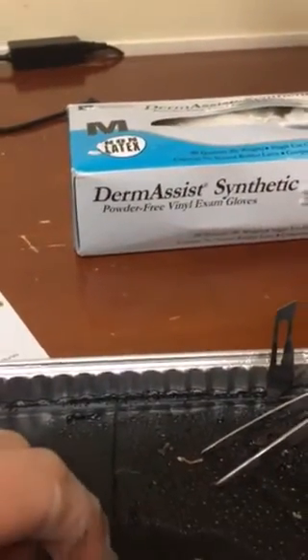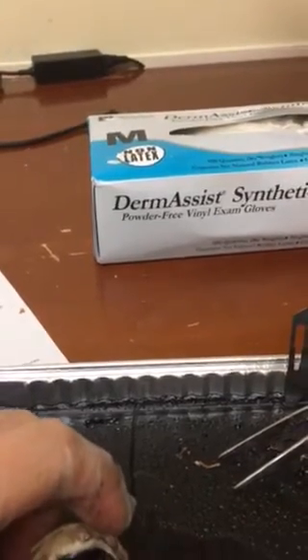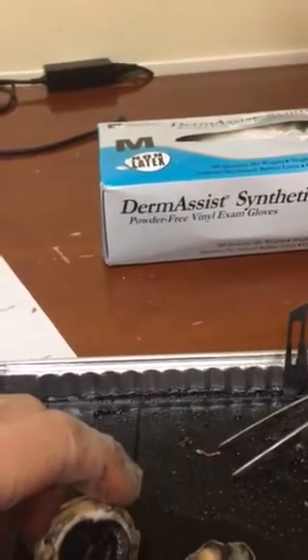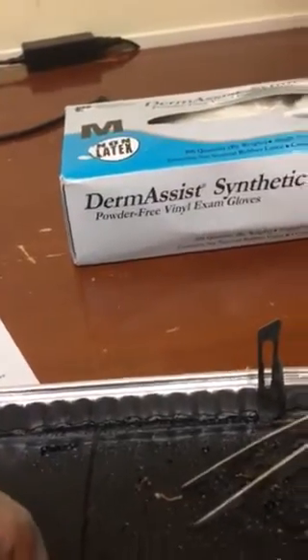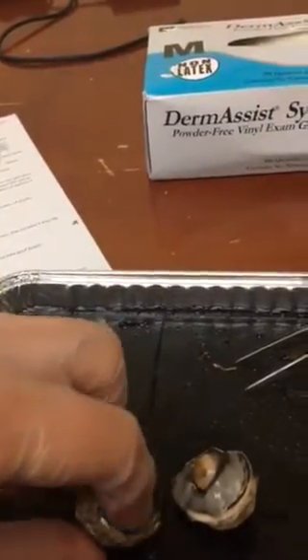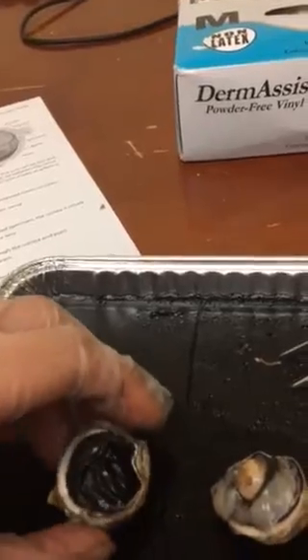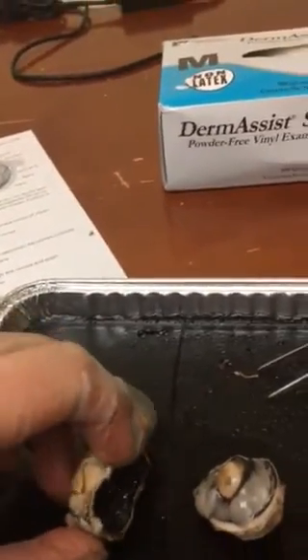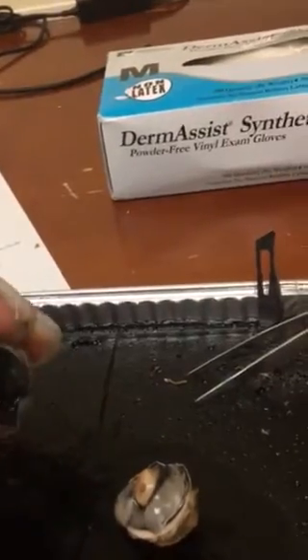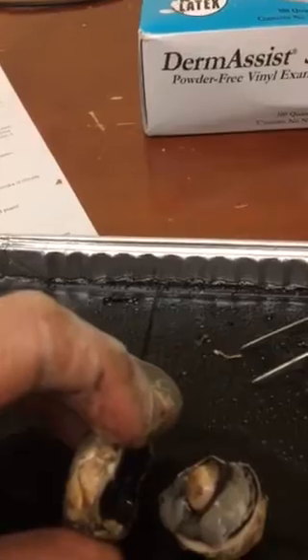The lens is held in place by the zonular fibers. They suspend the lens and stretch it to focus into vision. And then the hyaloid fossa, which would be right back in here, is an indentation in the center of the vitreous body that supports the lens. Unfortunately, I'm not able to find the lens in the mess I made to observe that.